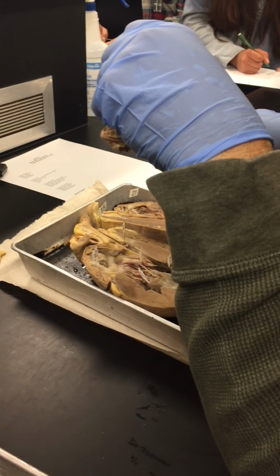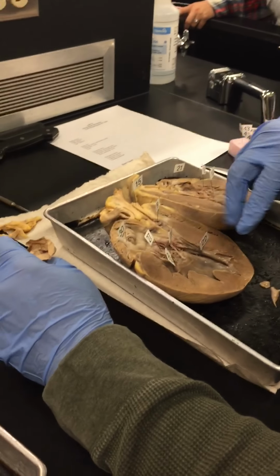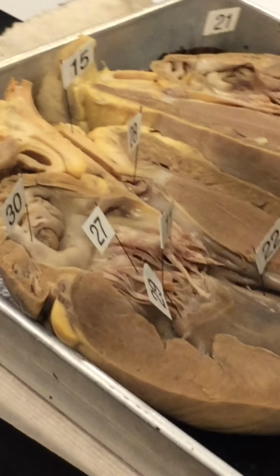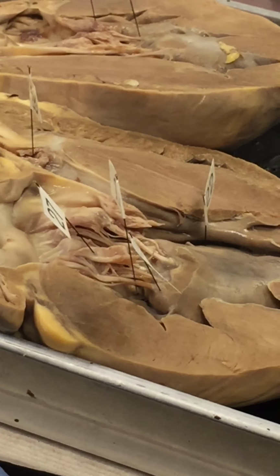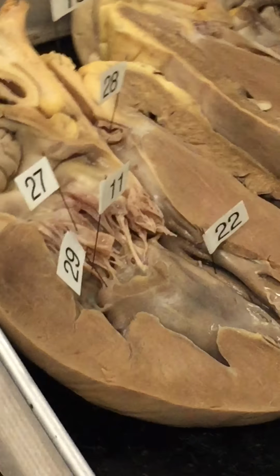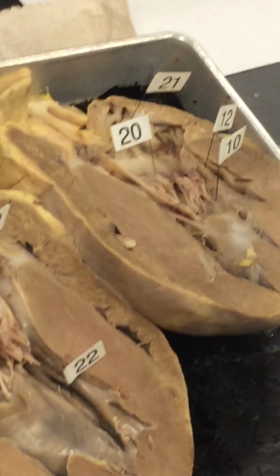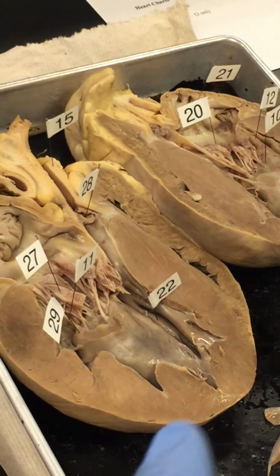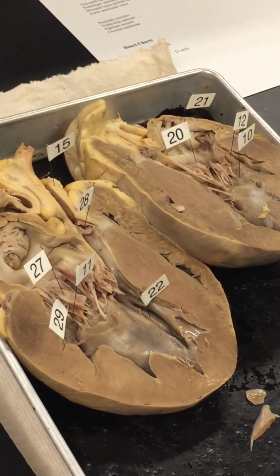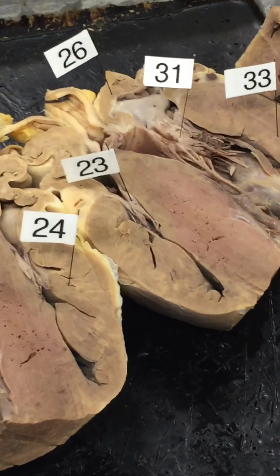And I can put one more in this valve here. The valve itself, the flap, since it's in the left heart, is the mitral valve or the bicuspid valve. So 27 is bicuspid valve, and 20 is also the bicuspid valve. Bicuspid or mitral, same exact thing. You can use either term. Is 23 also? 20 and 27. 23? Oh, I'm just kidding. I don't have it. It's on the other one. 23 is in the tricuspid valve.